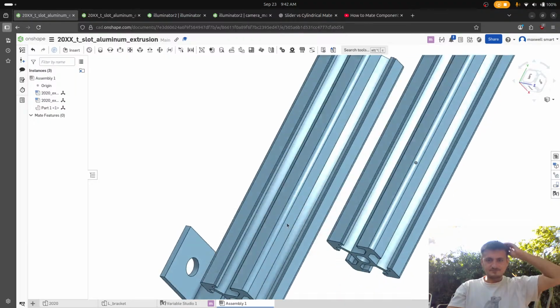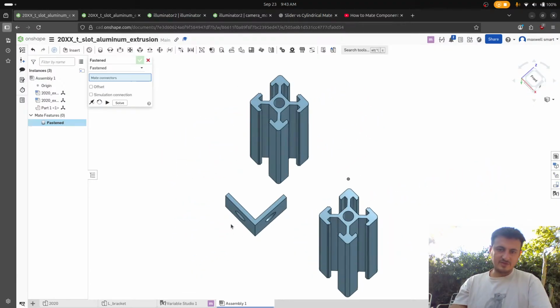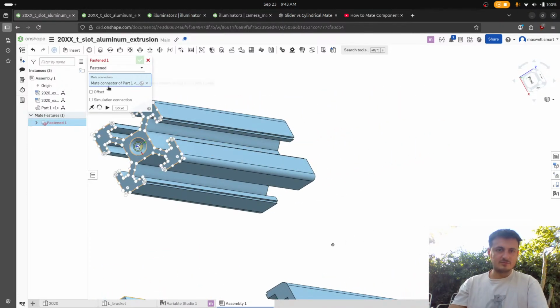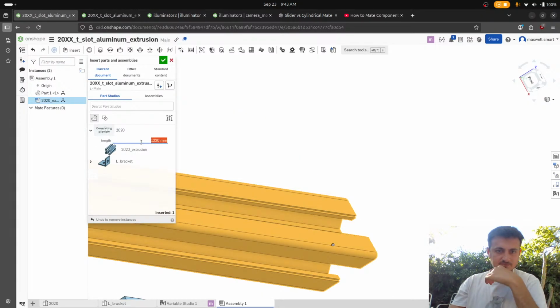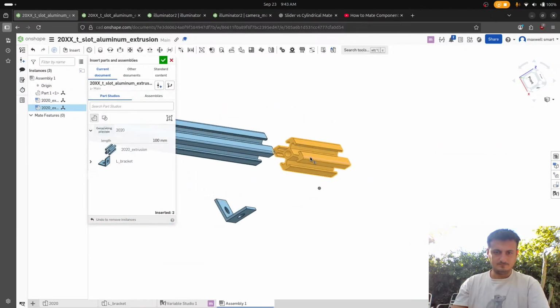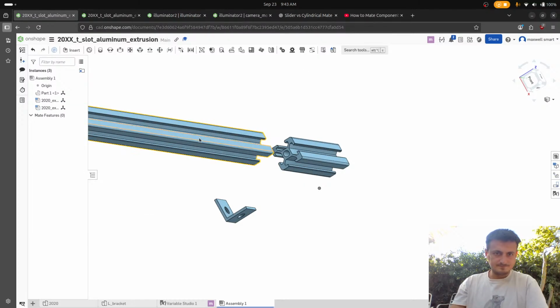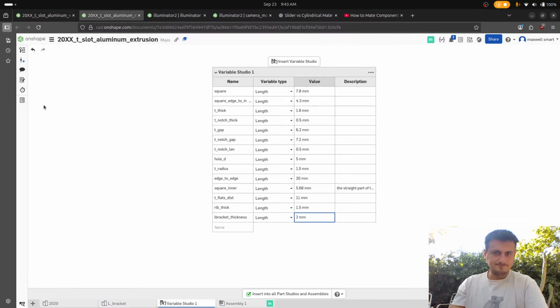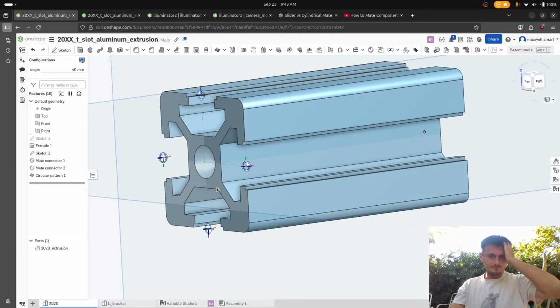Let's see. I don't even know. It's kind of fun. So wait, do we have the mate connectors or did they not update? We should have the mate connectors. So then if I go here, I don't know, they're not showing up. Maybe I have to regenerate them. Let's try to delete it and do it again. Maybe it was on the other side of it.